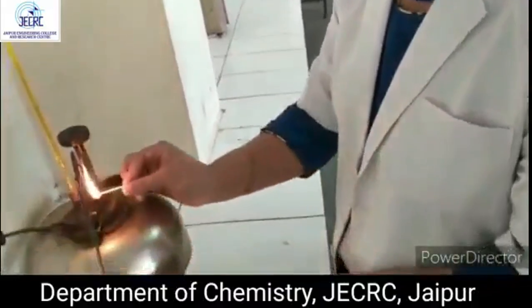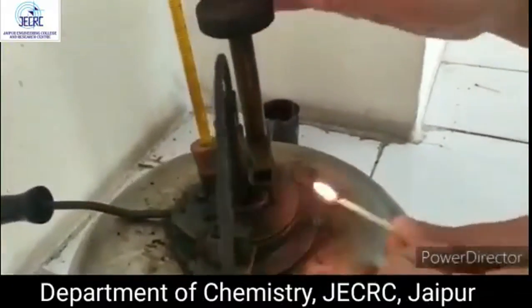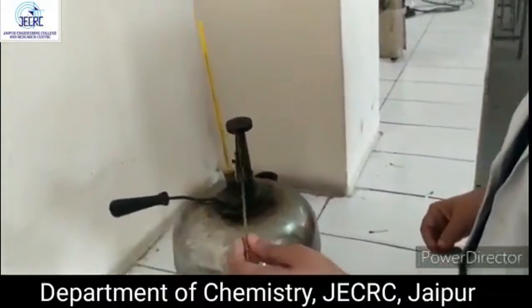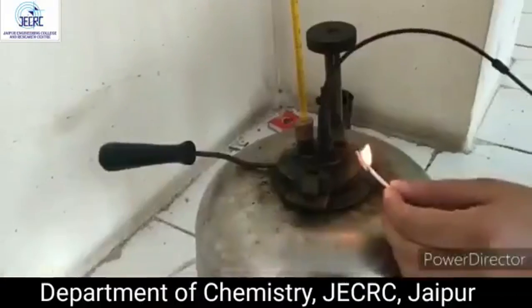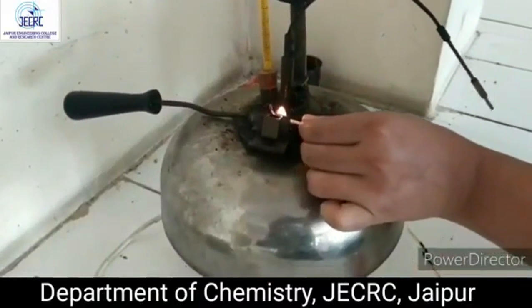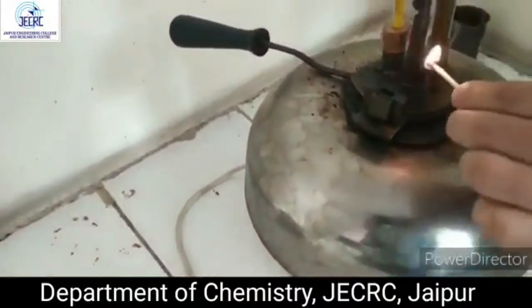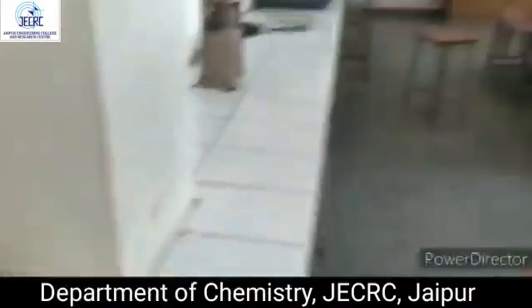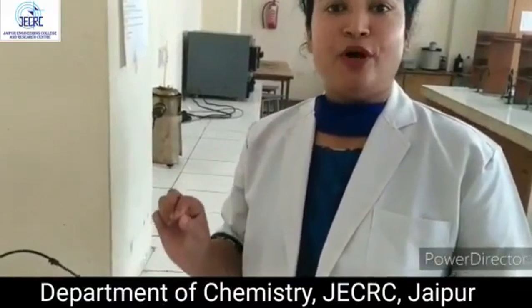Repeatedly, we take the reading and bring the matchstick near the pilot burner. Nothing happens. Continuously, we stir the lubricating oil so that the uniformity of heat is maintained in the lubricating oil. Now the flash point appears, a pop sound appears, and this is the flash point of the lubricating oil.